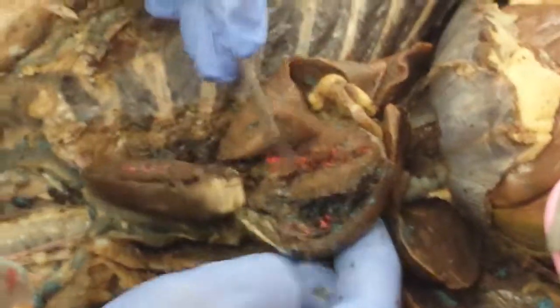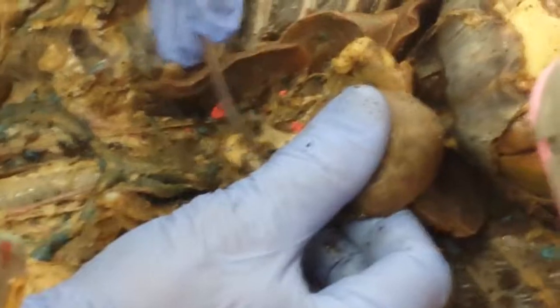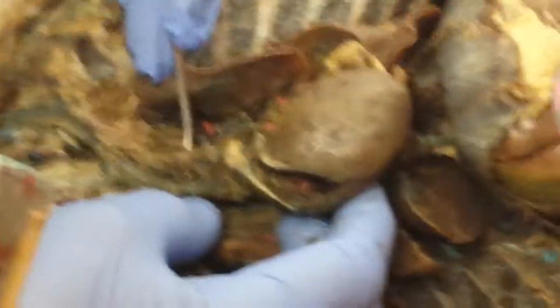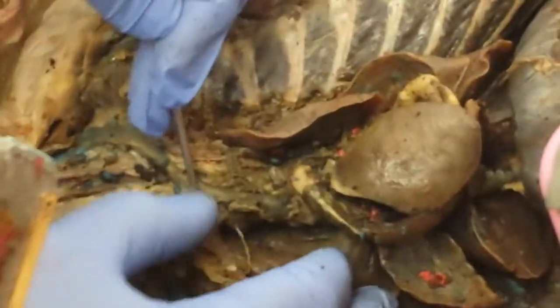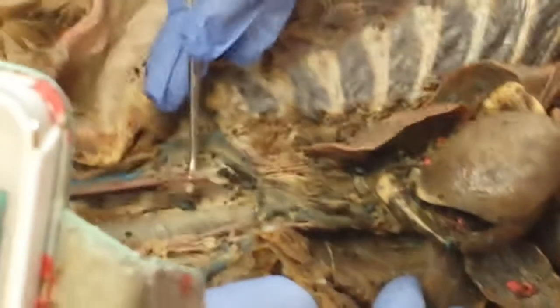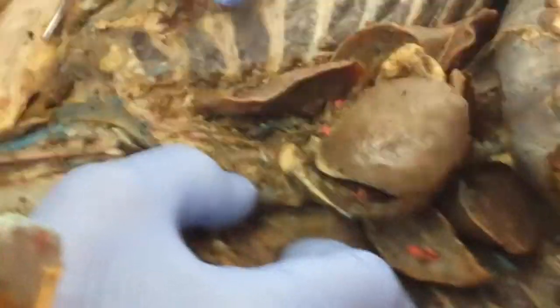It travels through the aortic semilunar valves to the arch of the aorta. Over the arch of the aorta, then the blood will travel through the brachiocephalic and the left subclavian. From the brachiocephalic, you have the right subclavian, right common carotid, left common carotid. From the left subclavian, it gives rise to the left axillary and left brachial.